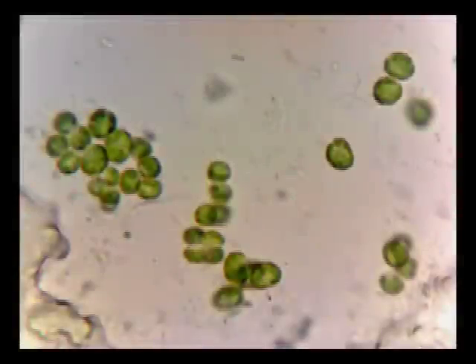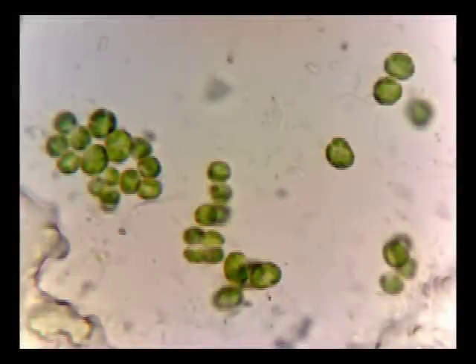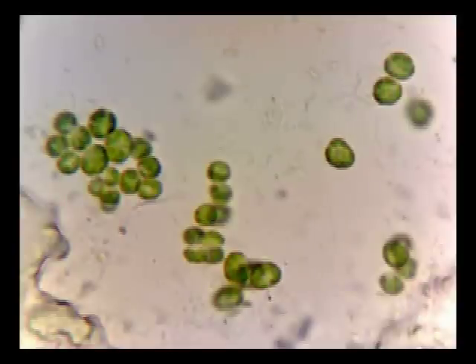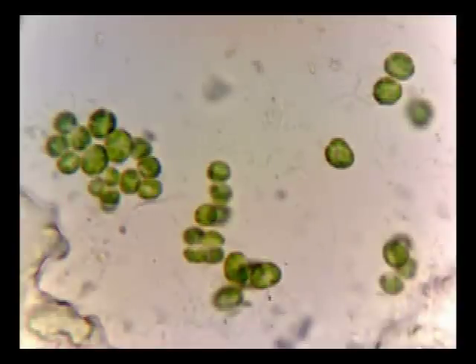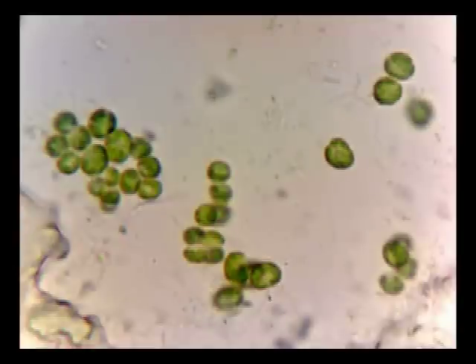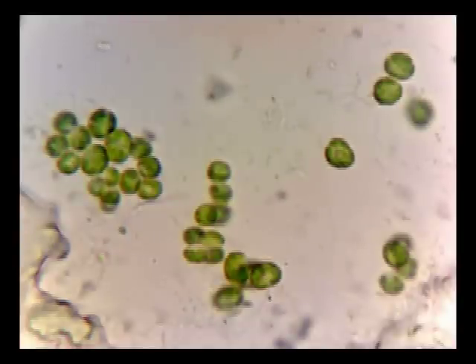In this video segment, running at normal time, you see many blue-green algae, also known as cyanobacteria, sitting there basically minding their own business. Nothing is really happening — you can see bacilli moving in the background, but other than that, nothing exciting.